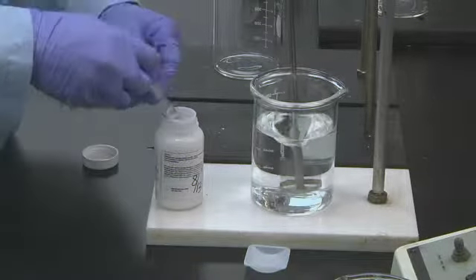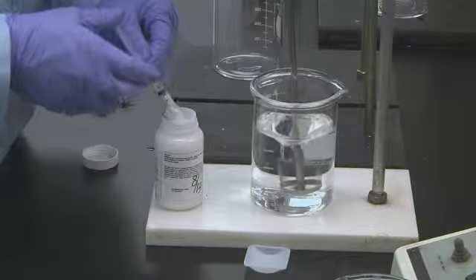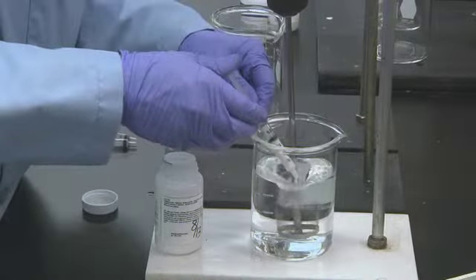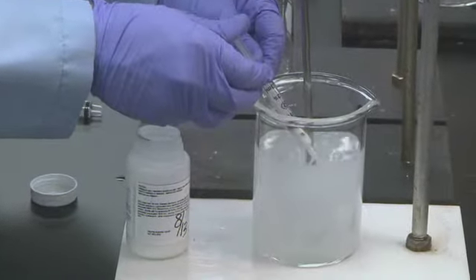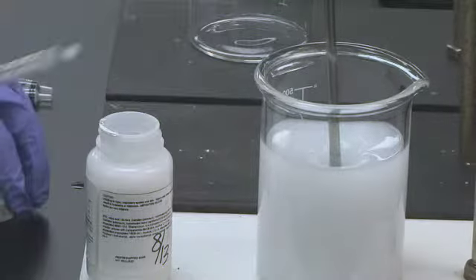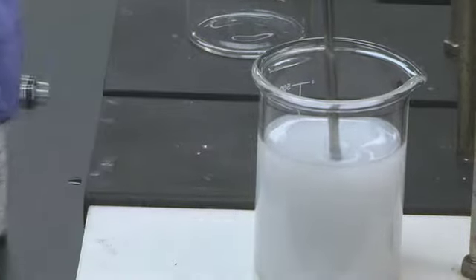Polymer is added to water at the desired concentration. The water should be mixed with a mechanical propeller type mixer to develop a good vortex. Add polymer slowly to the vortex. Syringe should not touch the water. Mix for 15 minutes, maintaining a good vortex.